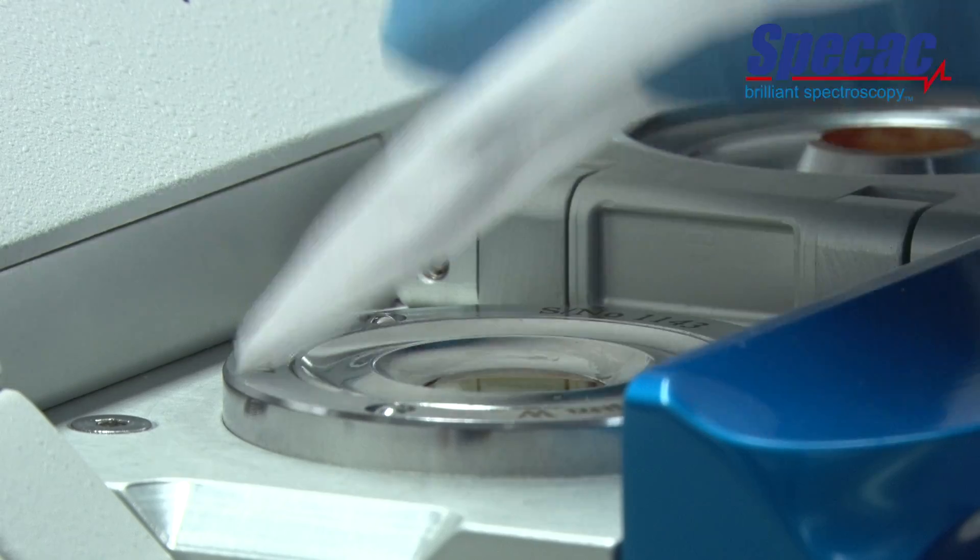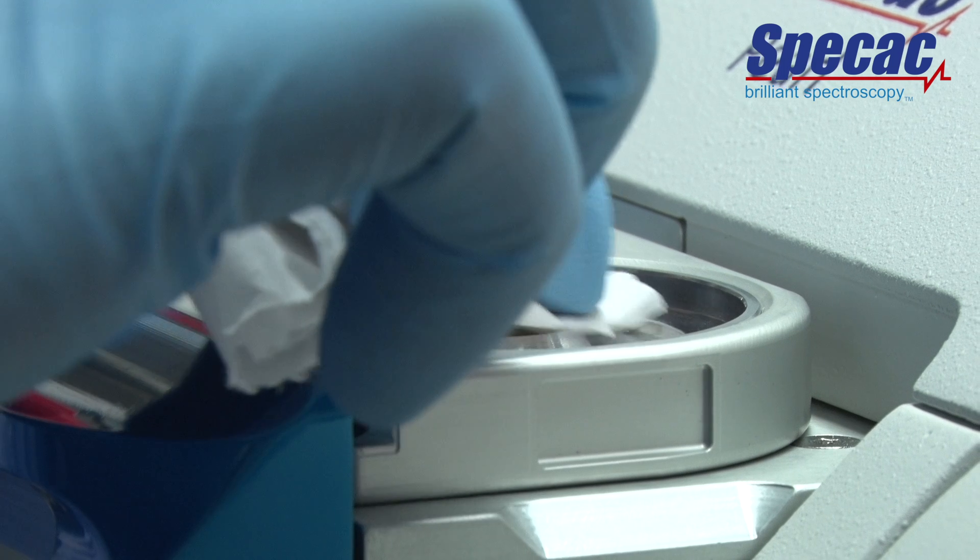Users can easily make calibration curves for more in-depth quantitative product analyses, for instance to determine fat concentration in their sample. After the spectra are recorded, cleaning the oyster cell is quick and easy. Simply open the sliding tray and use the hinged mechanism to access the sample. Use a moistened lens tissue with a suitable solvent to remove the sample and wipe down with a dry lens tissue.